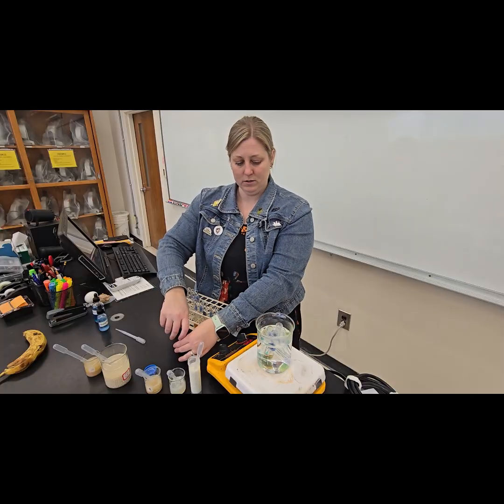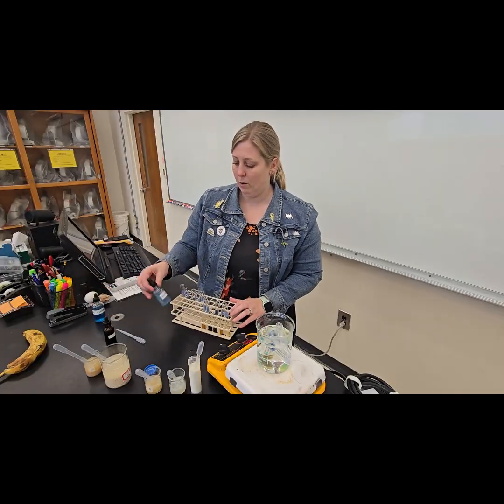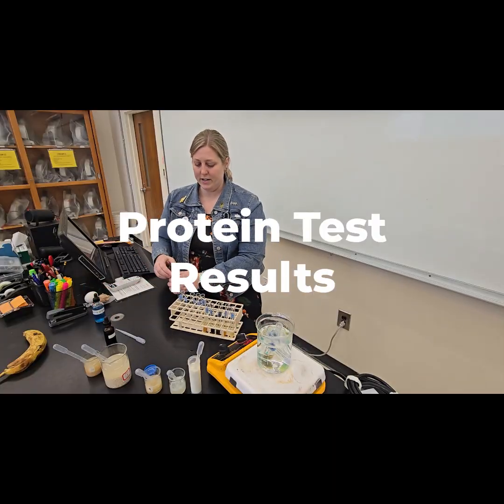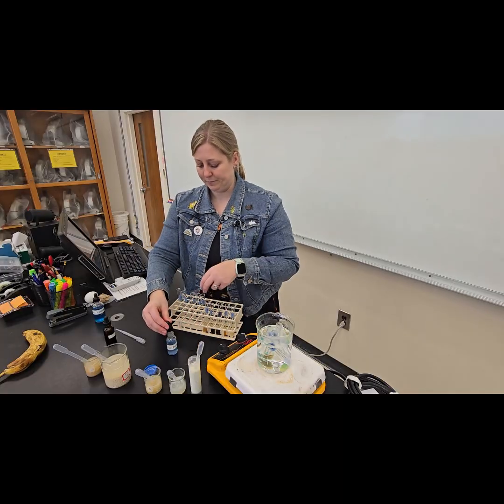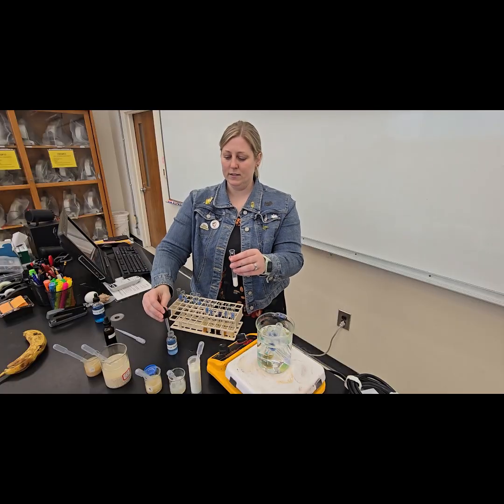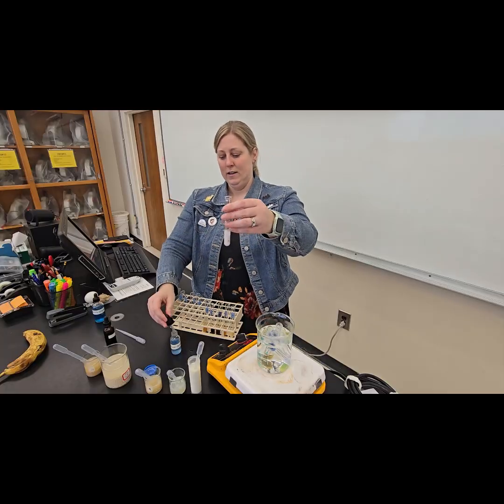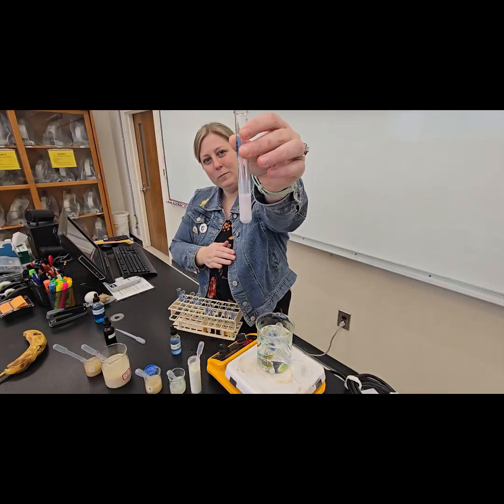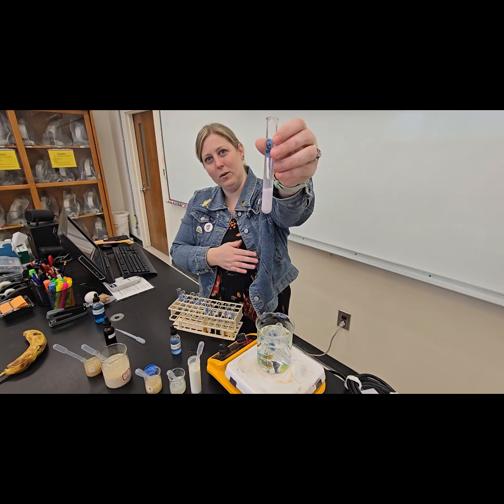Okay, hopefully you got those good results. And we're going to do the same thing for our protein test using the Biuret reagent. So for our protein test, we have our milk, Biuret. Let me do 2 drops here because Biuret is very faint. And we might see a color change there. I hope that's showing up on the camera.